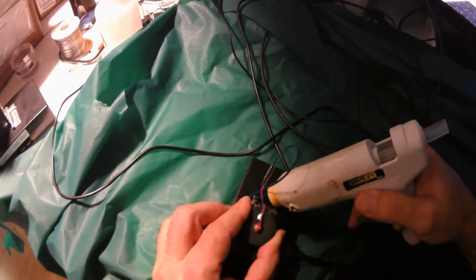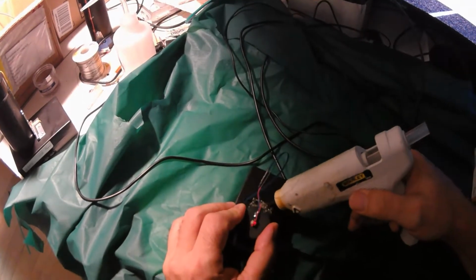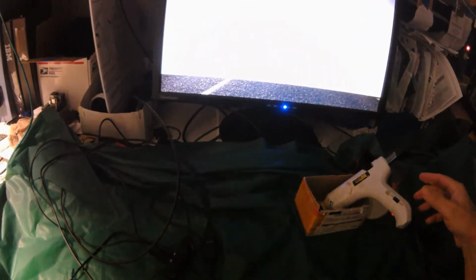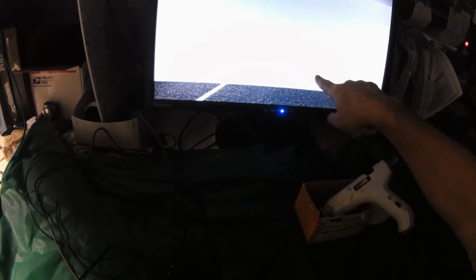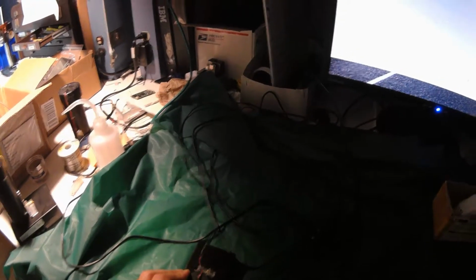It's oozing out everywhere, which is fine. All right, so hot glue's a little forgiving. I'm going to just make a little tweaking of position. And that looks good. And so now I'm just going to clean up the edges a little. Now we just wait. Let's hold it until it hardens. I tried cleaning the screen with alcohol, so these are the alcohol drops that evaporated. This dot seems to be permanent. It might be underneath. Perhaps cleaning the glass with alcohol right before mounting it is a good idea. Okay, that's it for this.